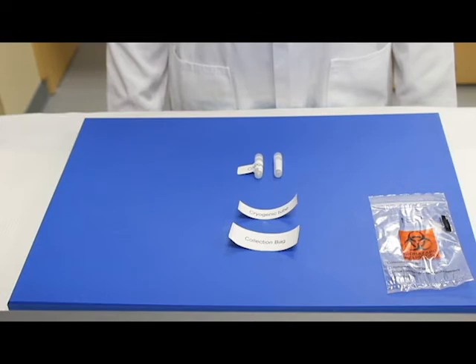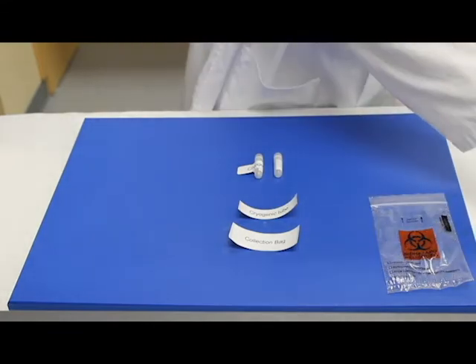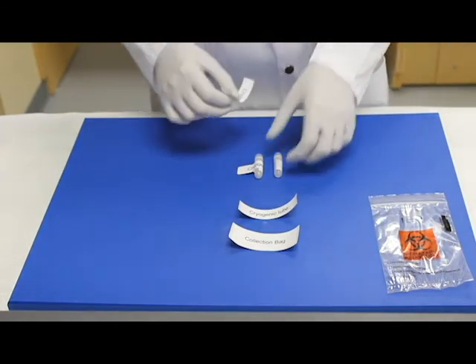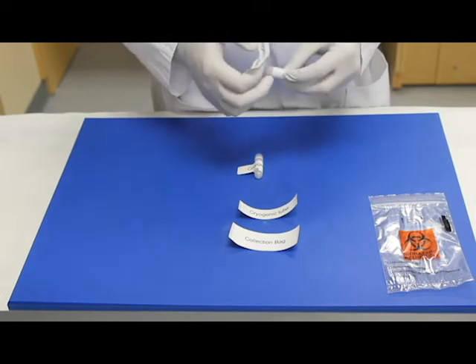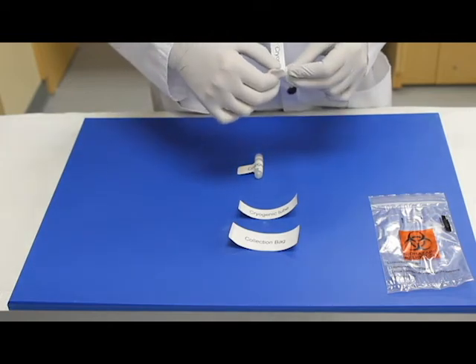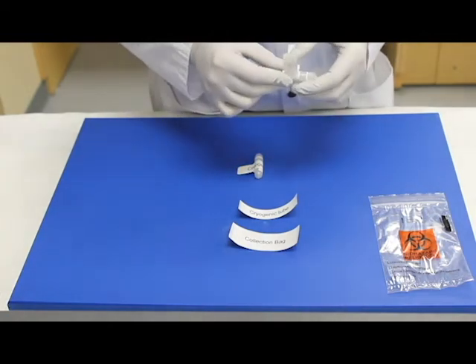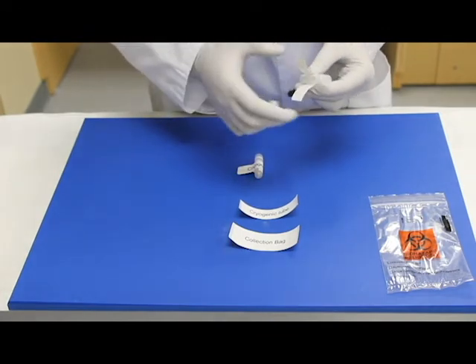We are ready to carry out the pre-biopsy procedures, about 30 minutes prior to receiving the sample. Start by labeling your cryotubes using water-resistant labels. Wrap the label around the tube from the middle of the label. Do not overlap the label obscuring information such as barcodes.